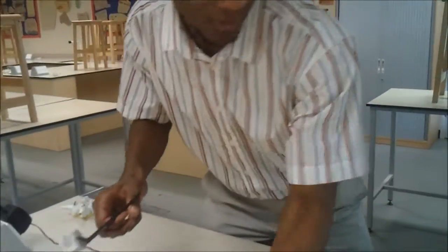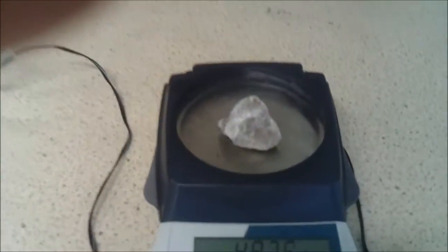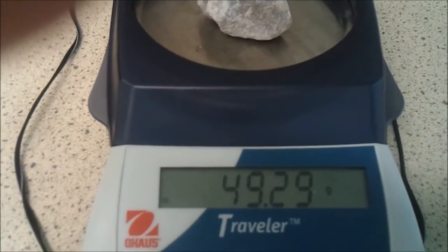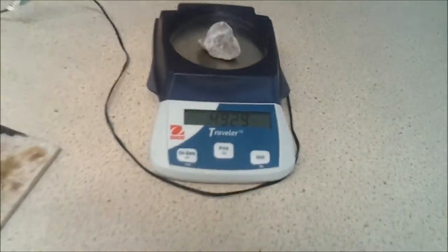So first of all I'm going to weigh this and it shows that we've got 49.29 grams at the start.